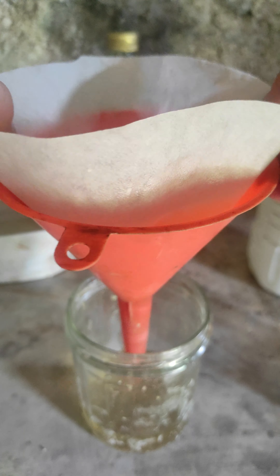After some hours the product is dry and we can measure the yield. For the final step we heat the powder in this type of setup. The water-filled balloon and the walls of the beaker are going to catch the deposition of phenol crystals.